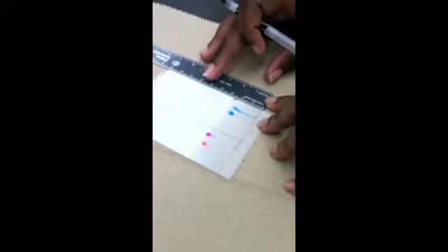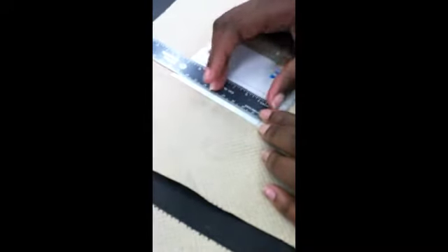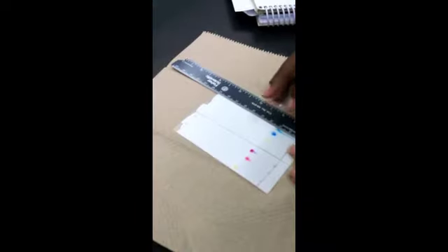And it stops at 2.6, so I'm going to put that as my denominator for all of them. Then I am going to measure from the 1 centimeter line to the middle of the dot. It's 2.3. 2.0.